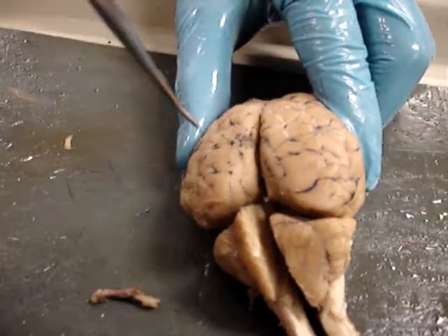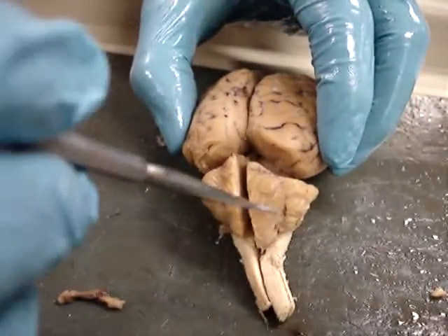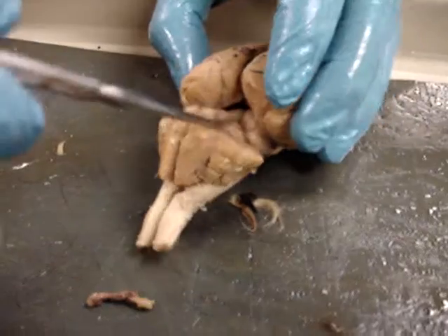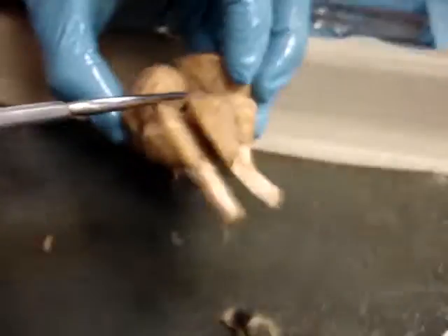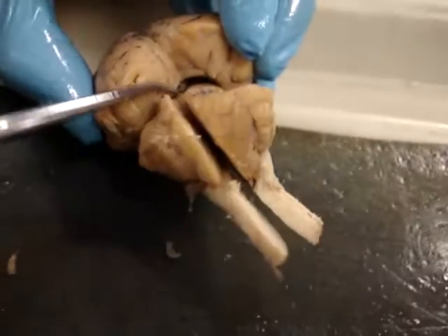Cerebral hemispheres. This is the cerebellum, spinal cord. When you look inside it, you have the superior and inferior colliculus.